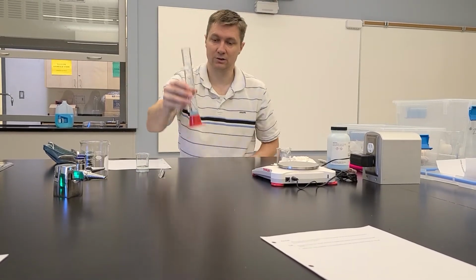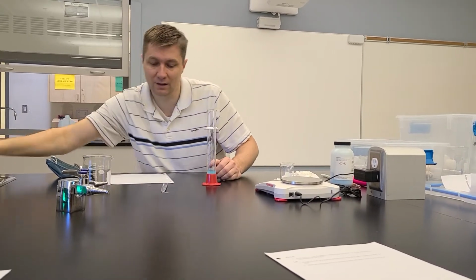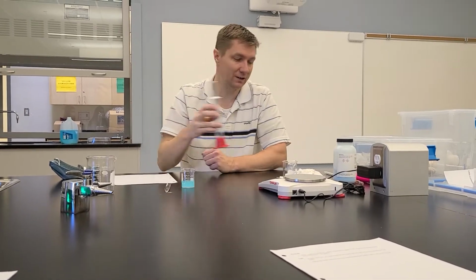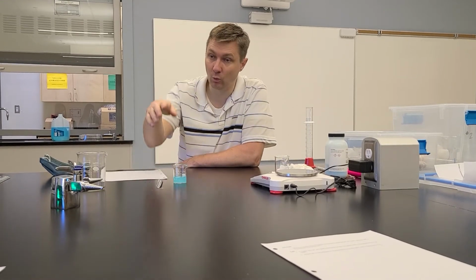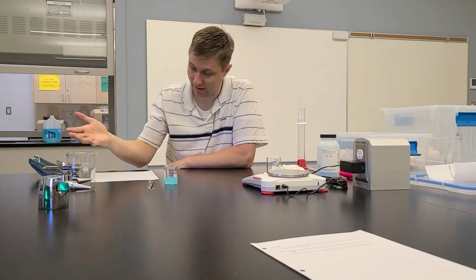And here's my stock solution. So I can pour this out. I don't need the rest of that water. And you can pour your stock solution back into here, okay? Now that is not the dilution. That is the preparation of the stock solution, right? So I've done what is in the pre-lab here, as well as lab number 1, step number 1, which is prepare the stock solution with that volume, 20 mils, and the concentration of 1 mole per liter.